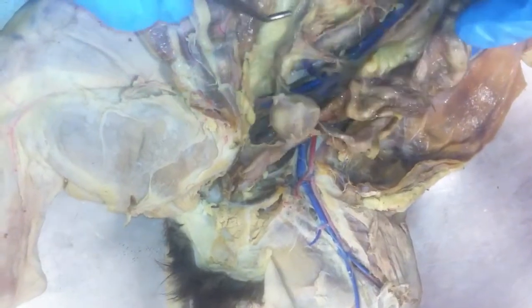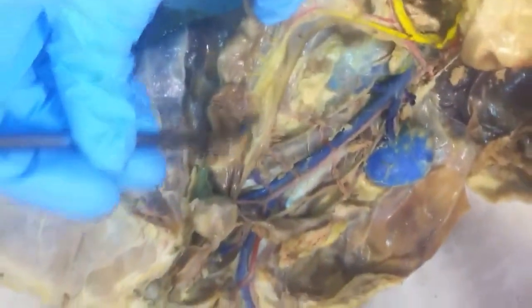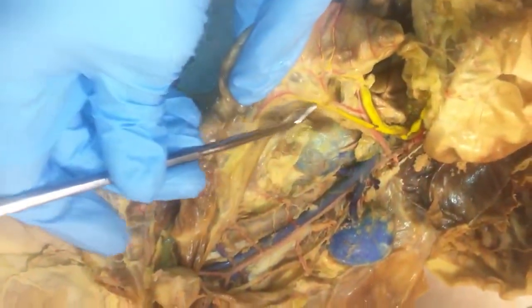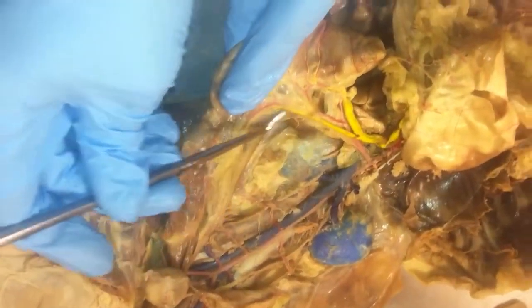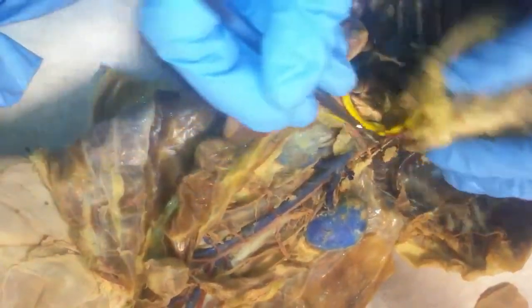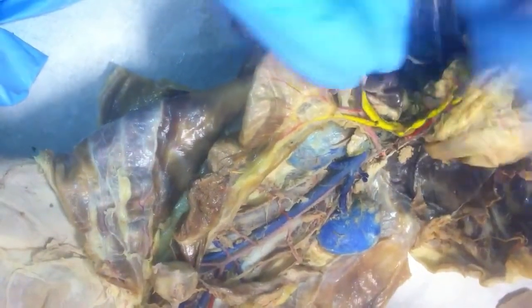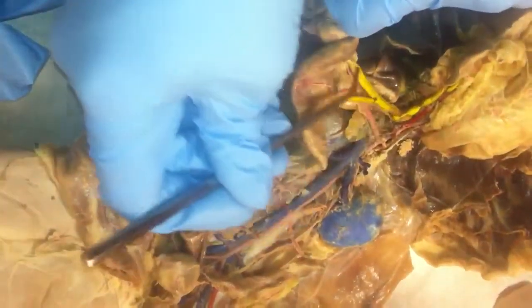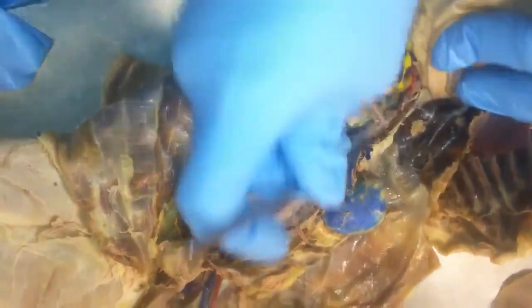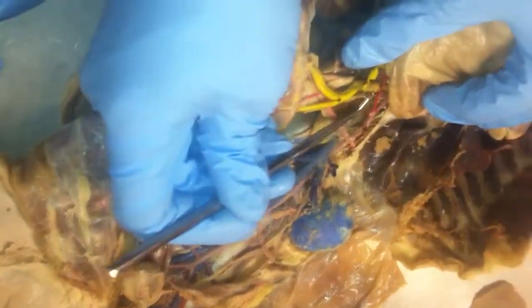Going back to the hepatic portal system. Again, this is the inferior mesenteric artery that goes to the large intestine. Going along the large intestine, and you can more clearly see it up here, is the inferior mesenteric vein. The inferior mesenteric vein and the gastrosplenic vein all meet up with the superior mesenteric vein. After that, the superior mesenteric vein becomes thicker and knobbier and becomes the hepatic portal vein.